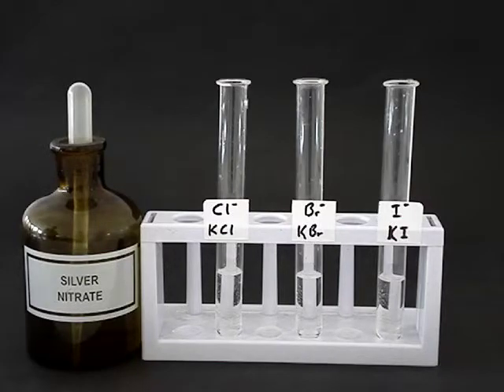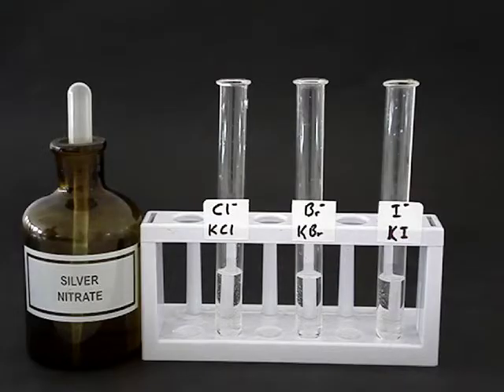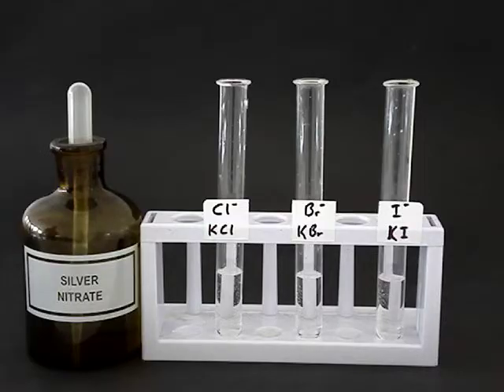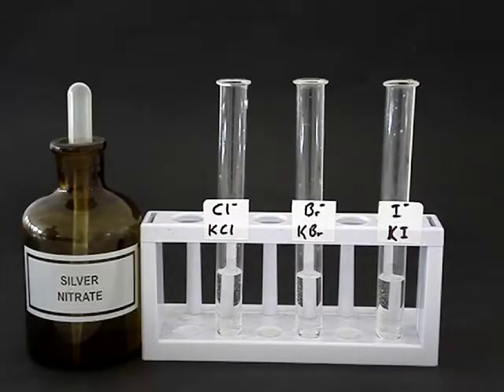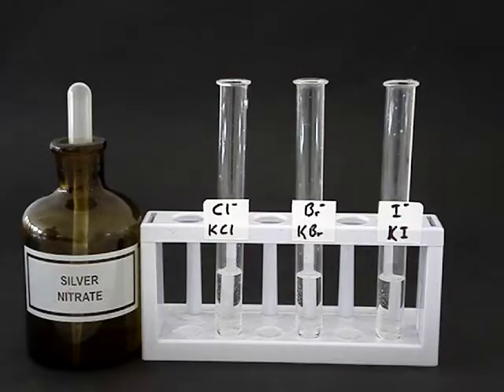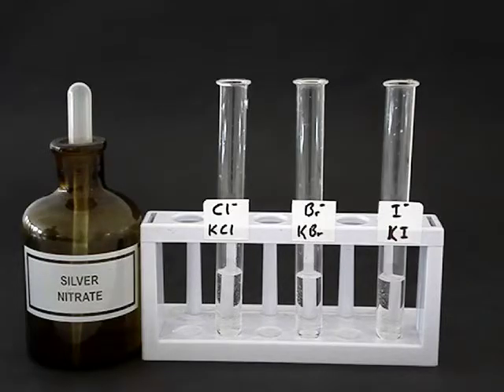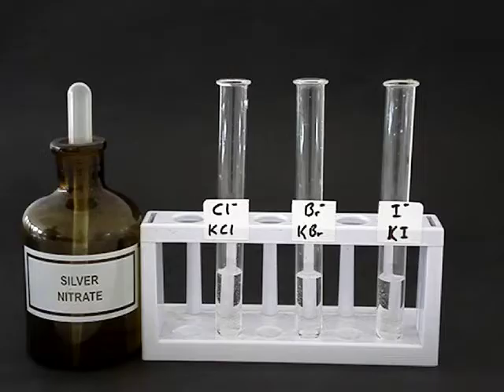Silver halides are insoluble. The presence of a halide can be shown by adding silver ions — if an insoluble product is formed, that shows that a halide was present. Here we have some silver nitrate, which consists of silver ions and nitrate ions, and we're going to introduce a bit of silver nitrate into each of these test tubes.